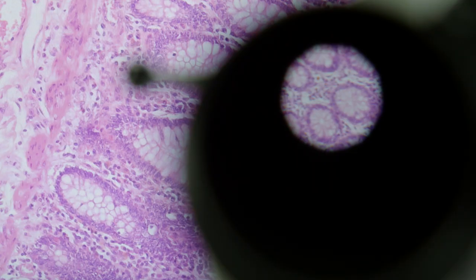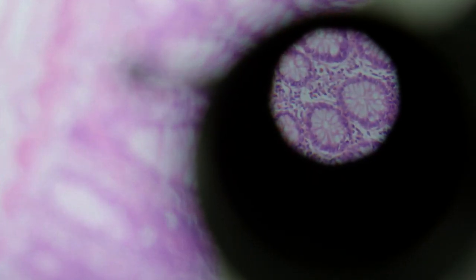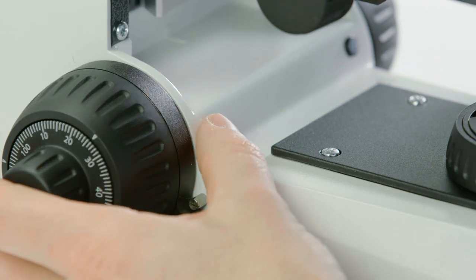The monitor and the eyepieces will show the same region of your sample with the same color impression. Press Snap.